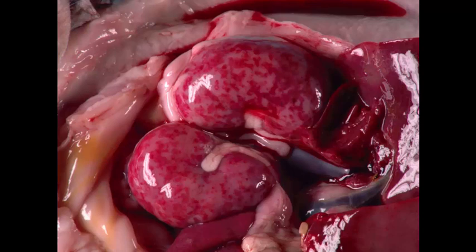I told you it was a puppy for a very good reason, because it'd be very difficult to get two classic causes out of an adult dog. The morphologic diagnosis is multifocal to coalescing necrohemorrhagic nephritis. Some people always ask, is it a nephritis? Well, if you have an infectious agent, just go with an -itis — it makes it a lot easier. Two possible causes — this is classic puppy disease.